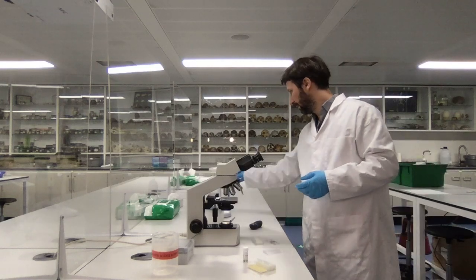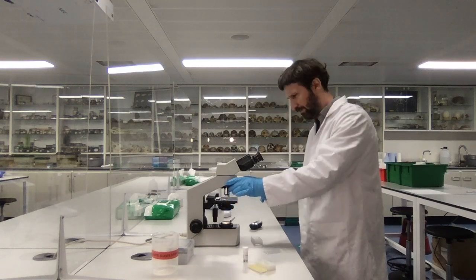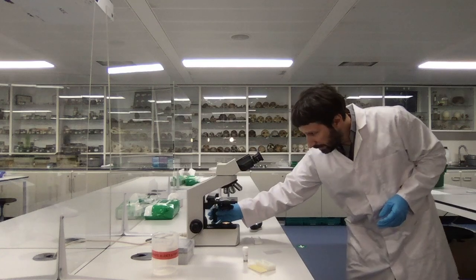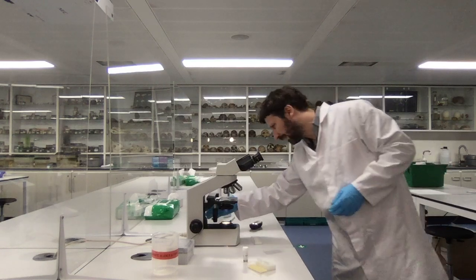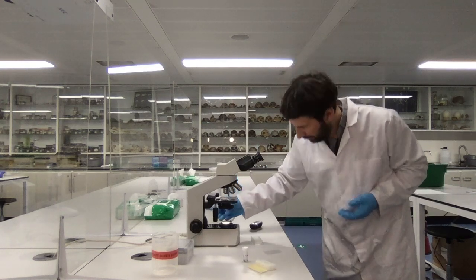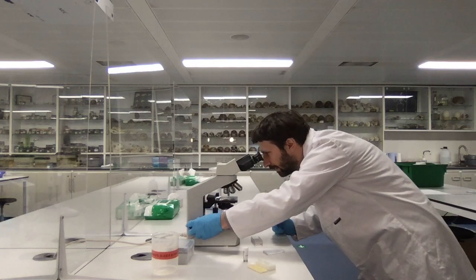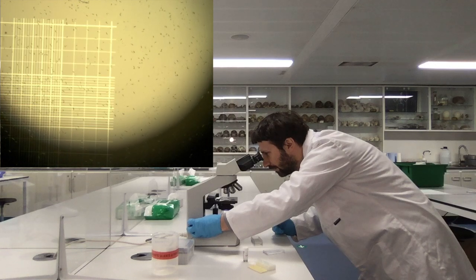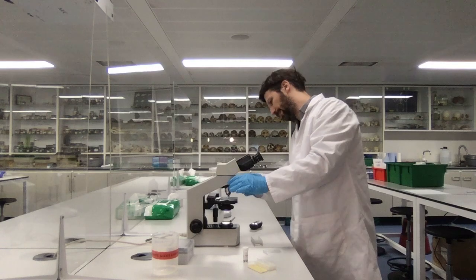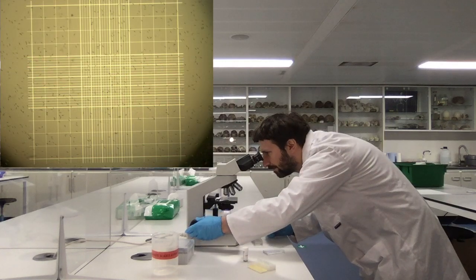Now I can hang the pipette and put the Neubauer counting chamber on the microscope. I start from the objective with the lowest magnification, place the slide on the stage, and make sure the light is centered with the stage opening just above the counting grid. I start from the top and lower the focus a little bit until I see the grid — and I see a beautiful number of Euglena. They are quite small, so I can zoom in by changing the objective and focusing the condenser again.